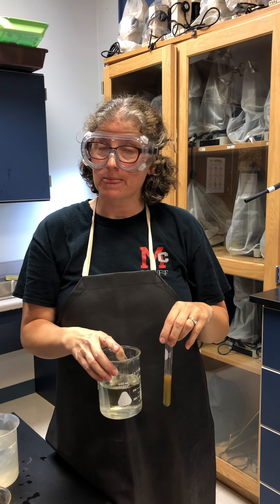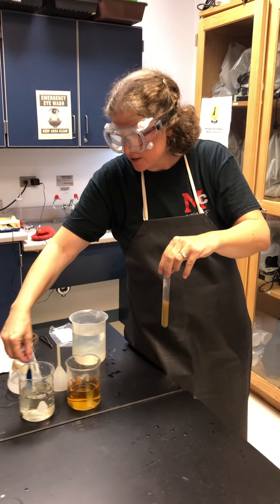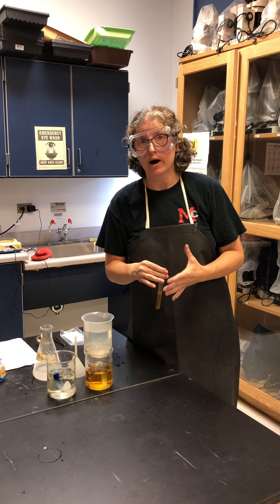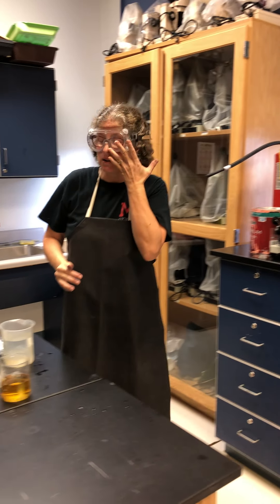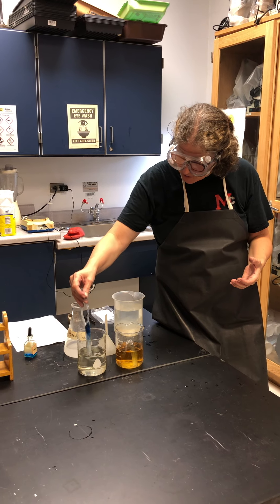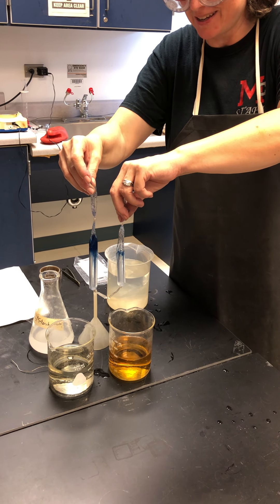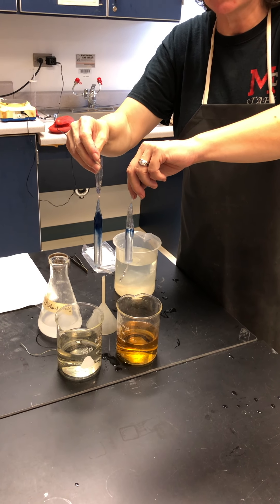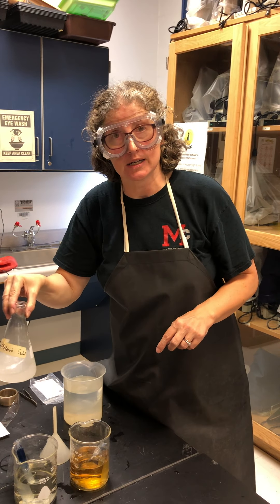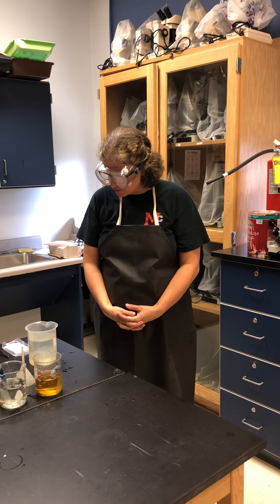So there were your three questions: did the starch move? Did the iodine move? And did the glucose move? You should have enough data to answer those three questions. The last question is, do you think osmosis is possible? Osmosis is the diffusion of water. Is it possible the bags gained or lost some water? If you leave it long enough, this bag looks a little more full than this one, and the only way that would happen is if water moved into it — drawn in because the inside is more concentrated than the iodine water outside.